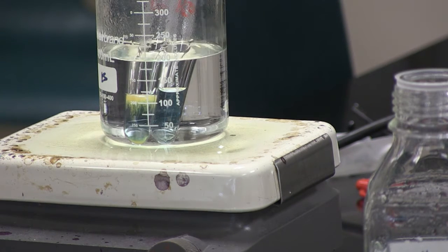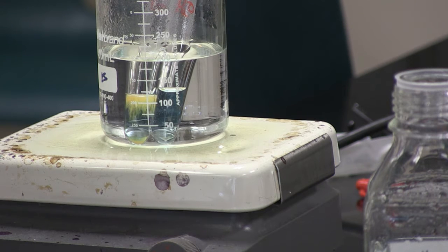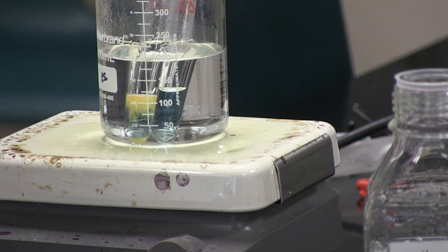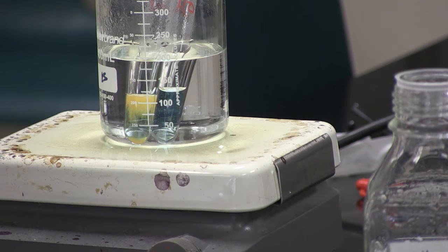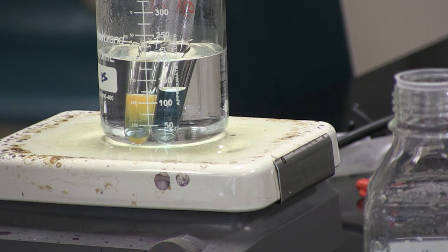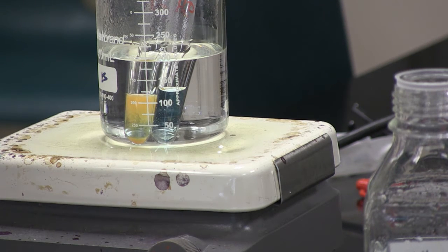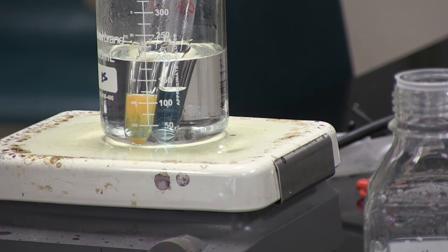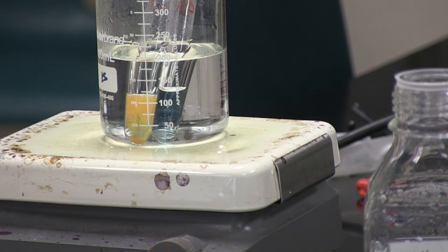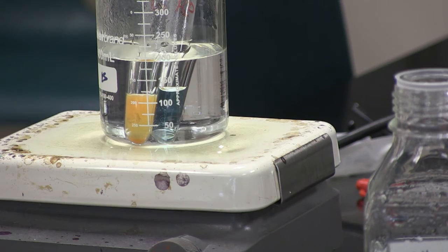We are starting to get yellow forming in the test tube that contains glucose, indicating the presence of a reducing sugar — and glucose is a reducing sugar. The water test tube has no color change. So Benedict's reagent tests for the presence of reducing sugars.